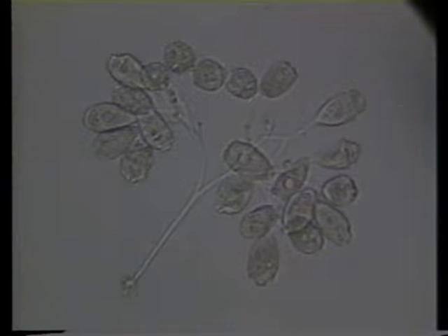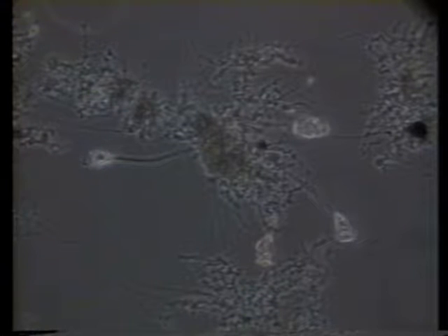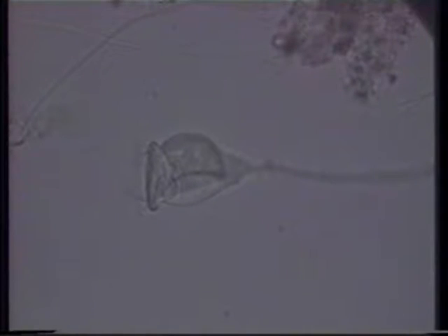Stalk ciliates look like branches with bell-shaped ends and are usually found attached to clumps of activated sludge floc. They do not swim, but can be seen coiling and uncoiling like springs as they feed on smaller organisms. Stalk ciliates are usually found when free-swimming ciliates can no longer successfully compete for the food supply. These ciliates are also an indication of stable and efficient treatment.